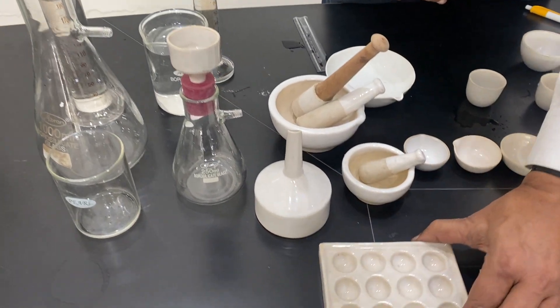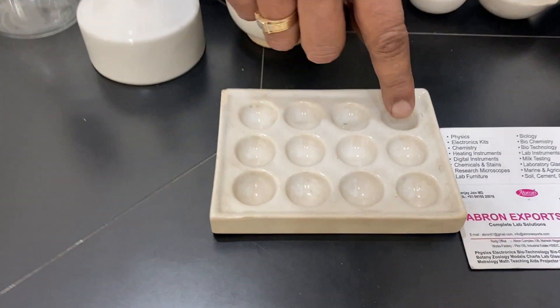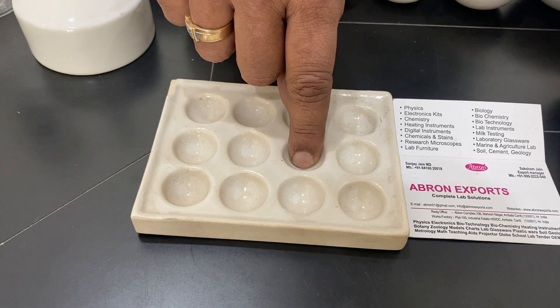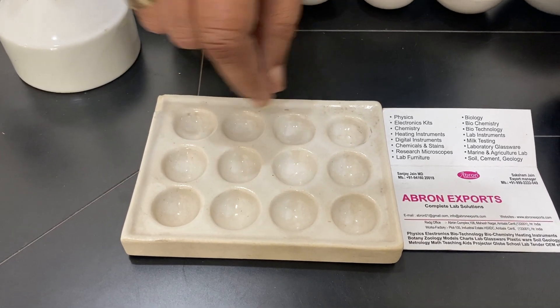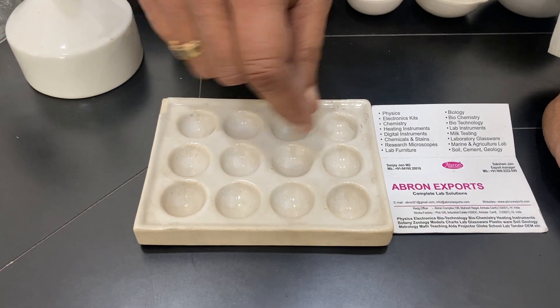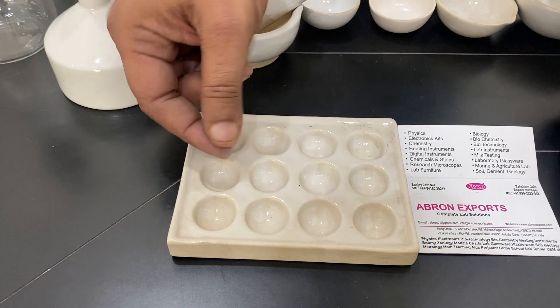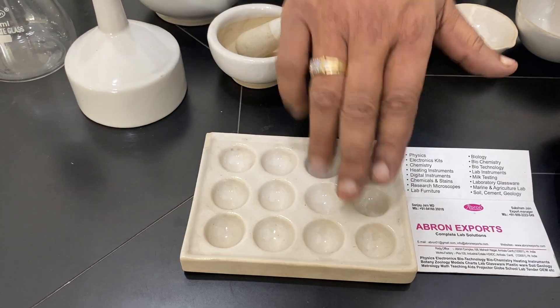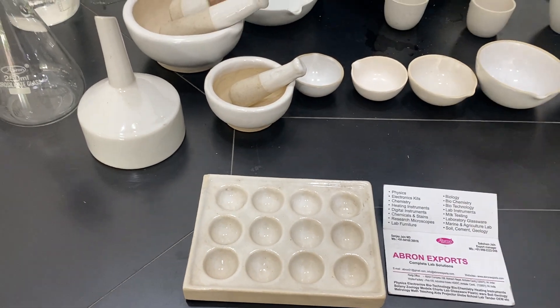Another product is a spot plate, also called an indicator plate. You can put a phenolphthalein solution and put a drop in it, or you can check blood — put one blood drop and then add the chemical. It is used for mixing or as an indicator. It comes in sometimes 6-well, 12-well, and 18-well sizes.